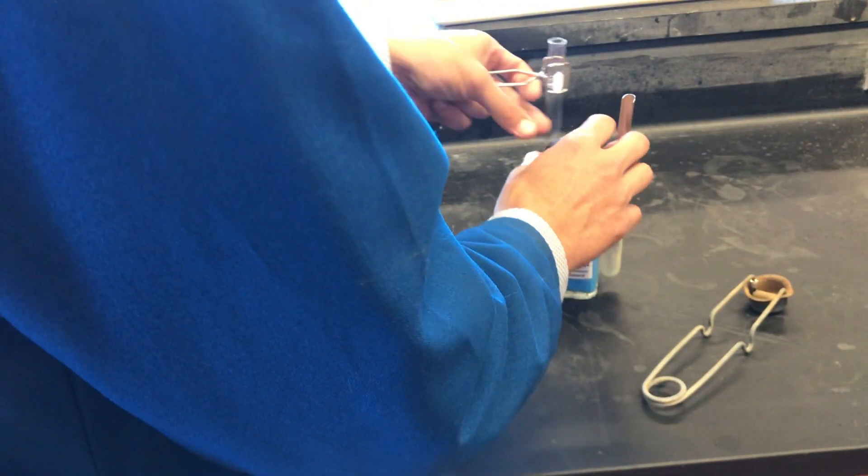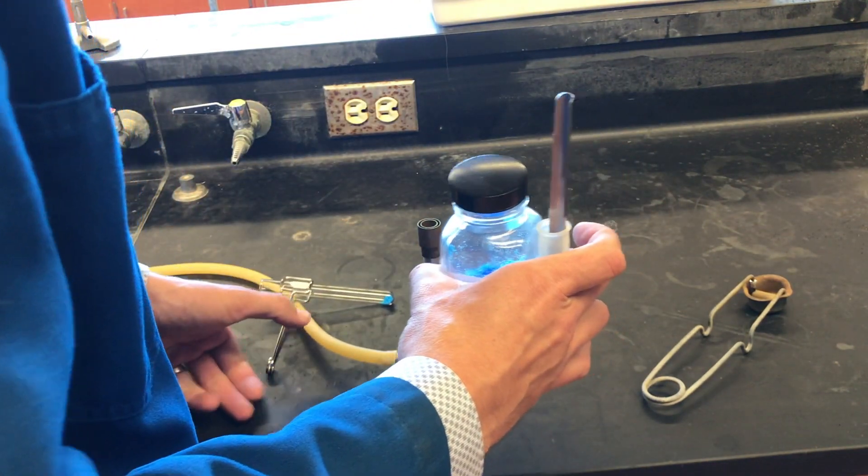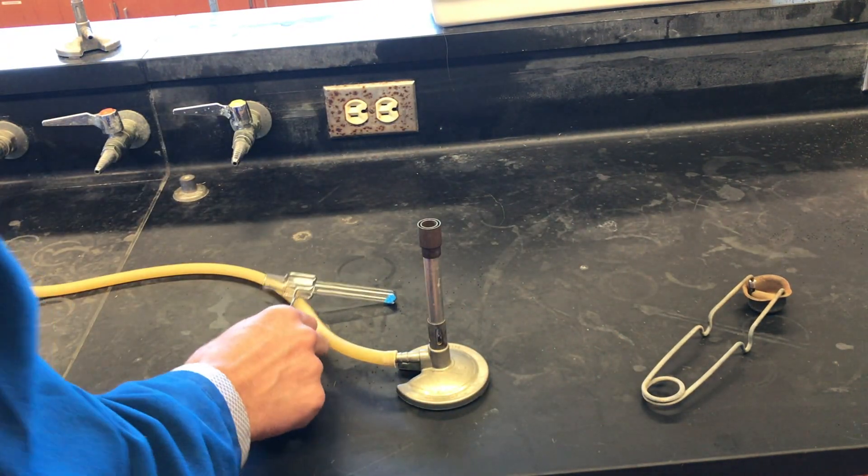We'll put a small pea-sized amount of our material at the bottom of the test tube and safely put our material away.